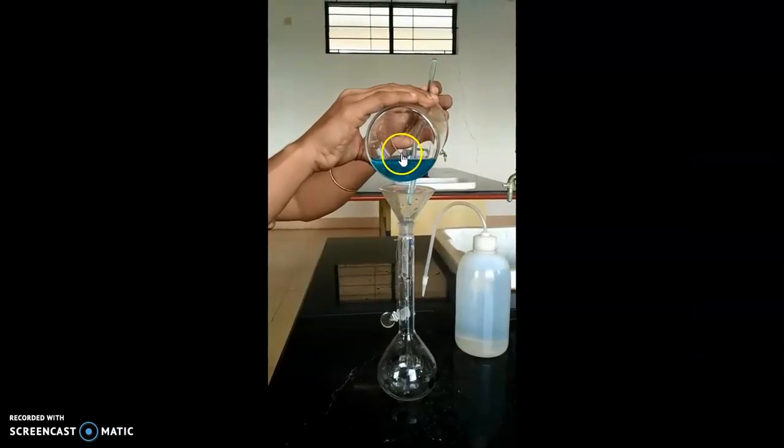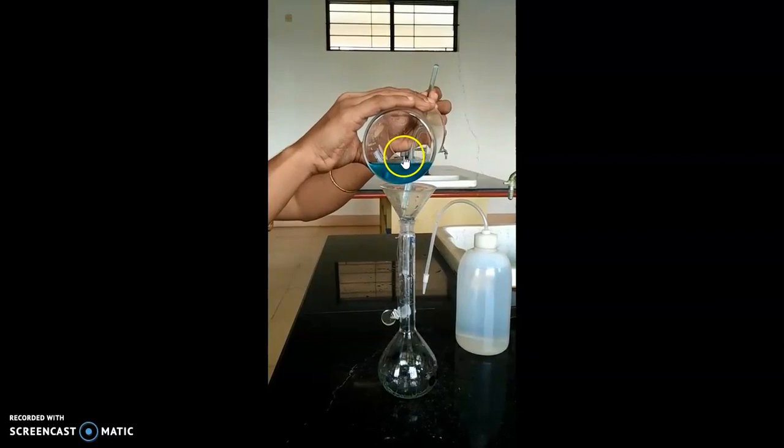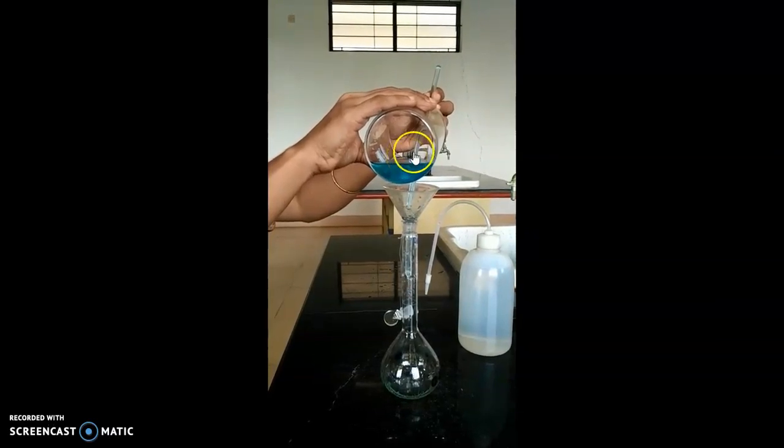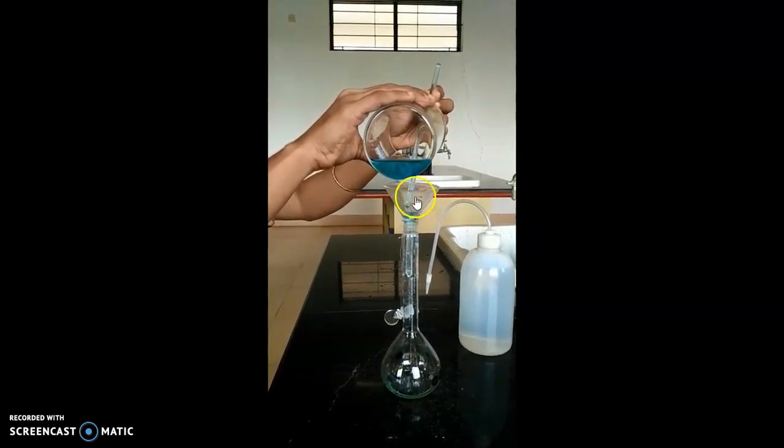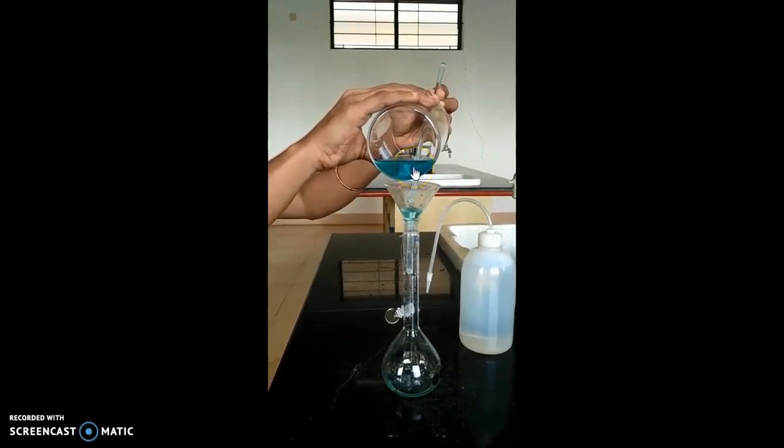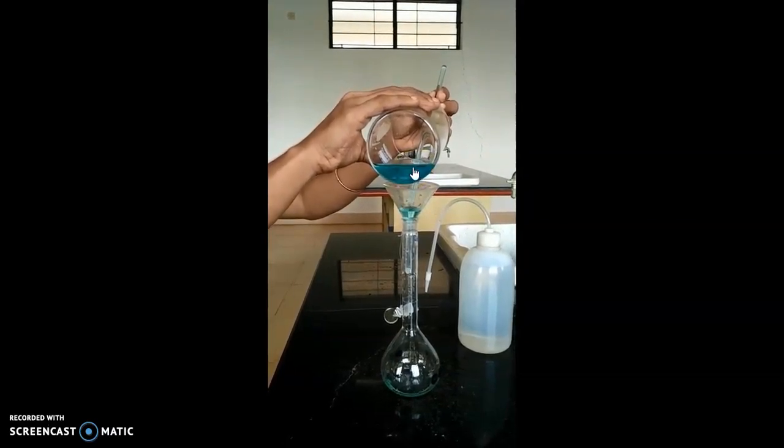This type of addition, where the cupric nitrate solution is added into the standard flask through the glass rod, avoids spillage and complete transfer of the solution.